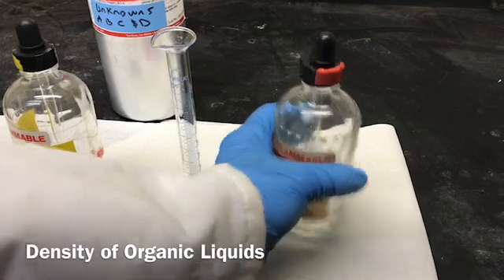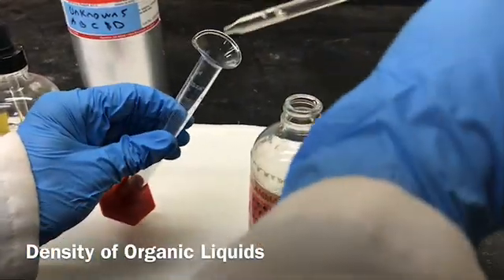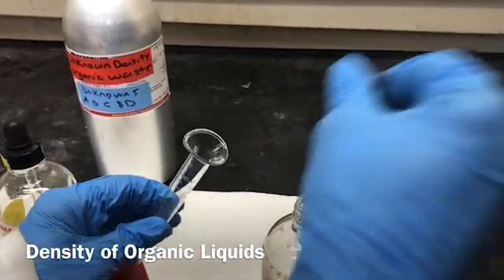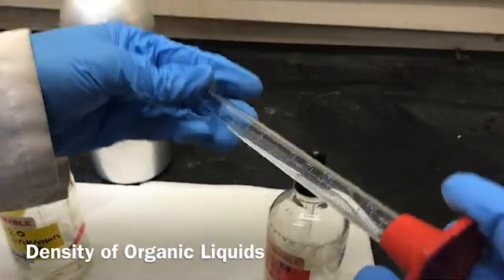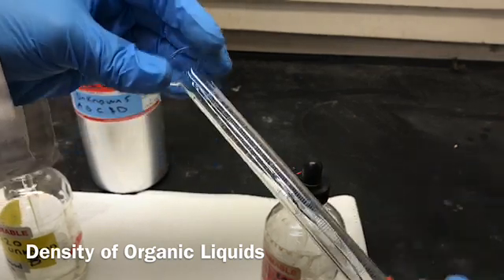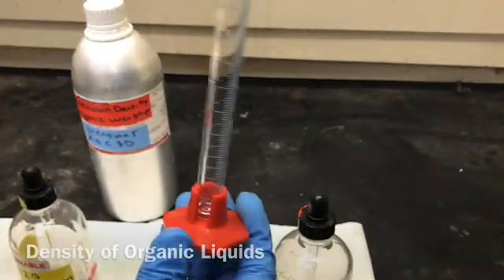So what I will do, I will add a few drops of unknown liquid D, and then I will condition the cylinder with this liquid. And I'm going to dispose of this into the waste container.